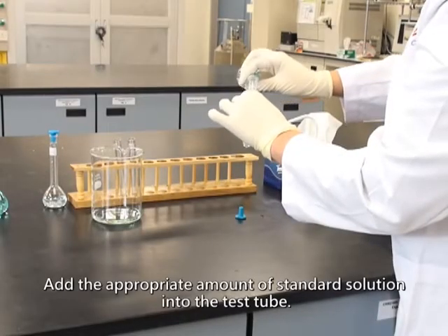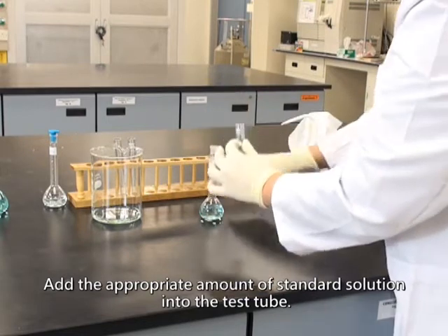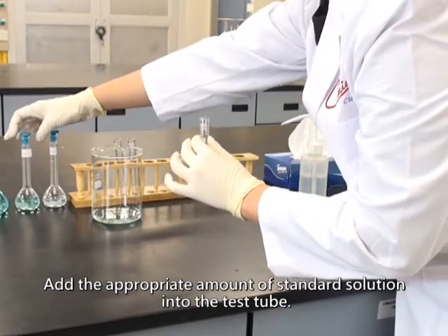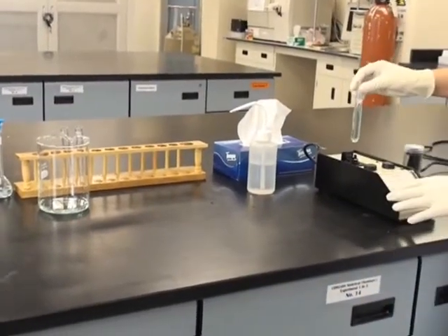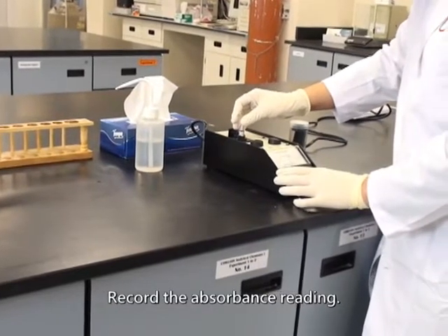Add the appropriate amount of standard solution into the test tube. Record the absorbance reading.